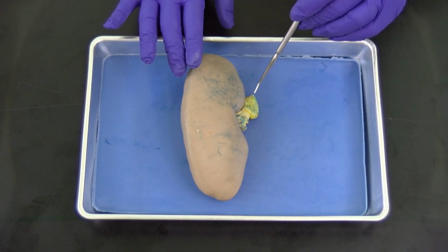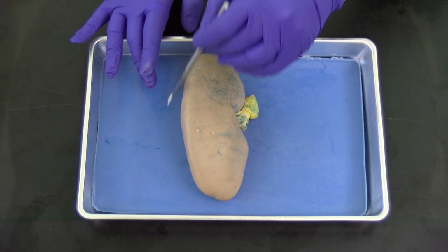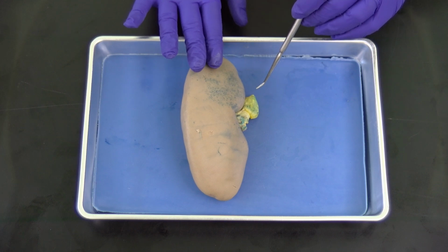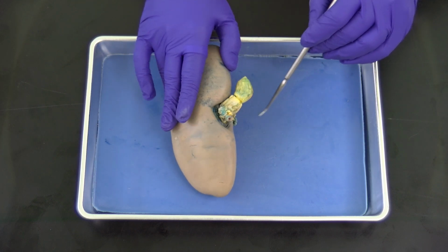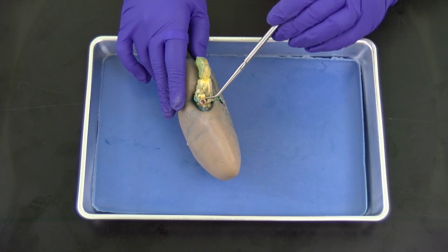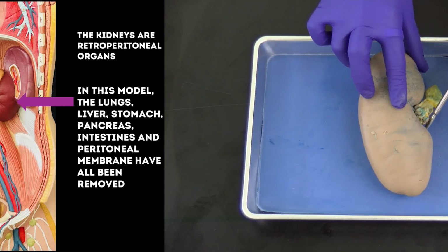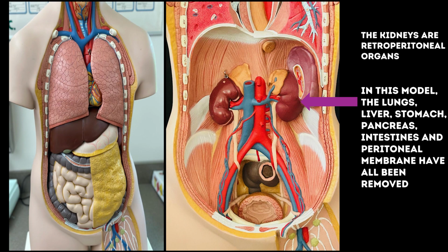There's also quite a bit of fatty tissue that surrounds the kidney that the lab supply company has conveniently cut away for us today. We might see some remnants of that when we're viewing this, but very little remnant of the fatty tissue that was here. Why that's so important is you may remember from early on in your study in A&P 1 of the body cavities is we have a peritoneum which surrounds most of the abdominal organs.